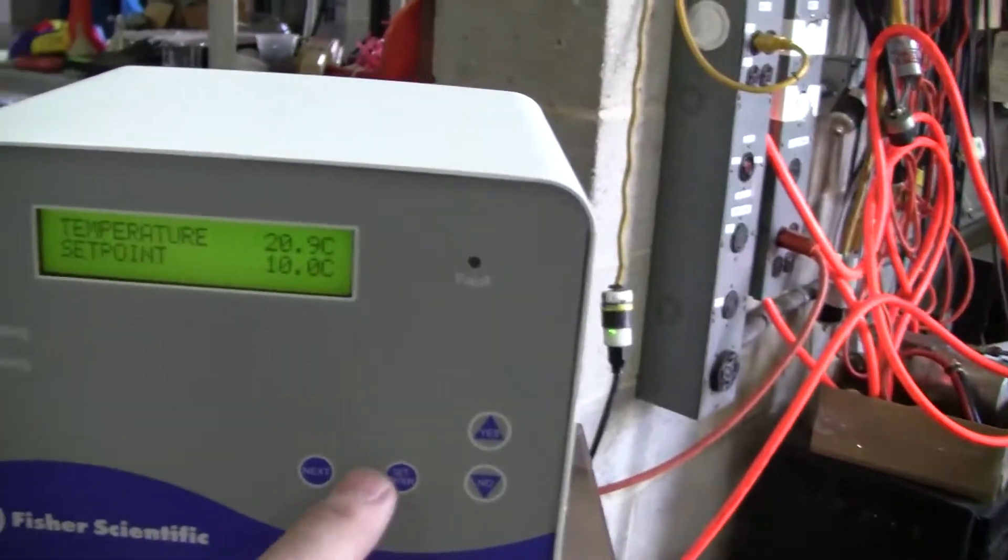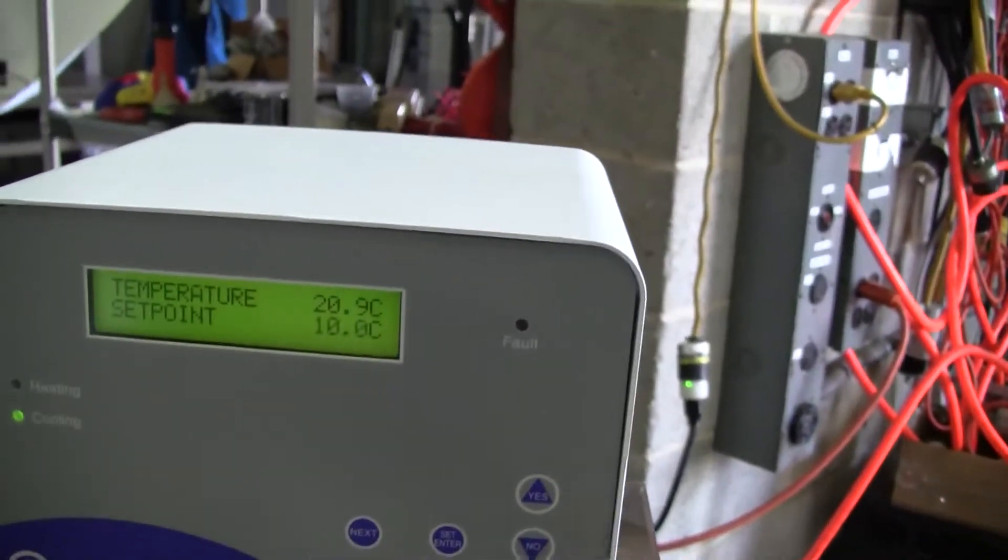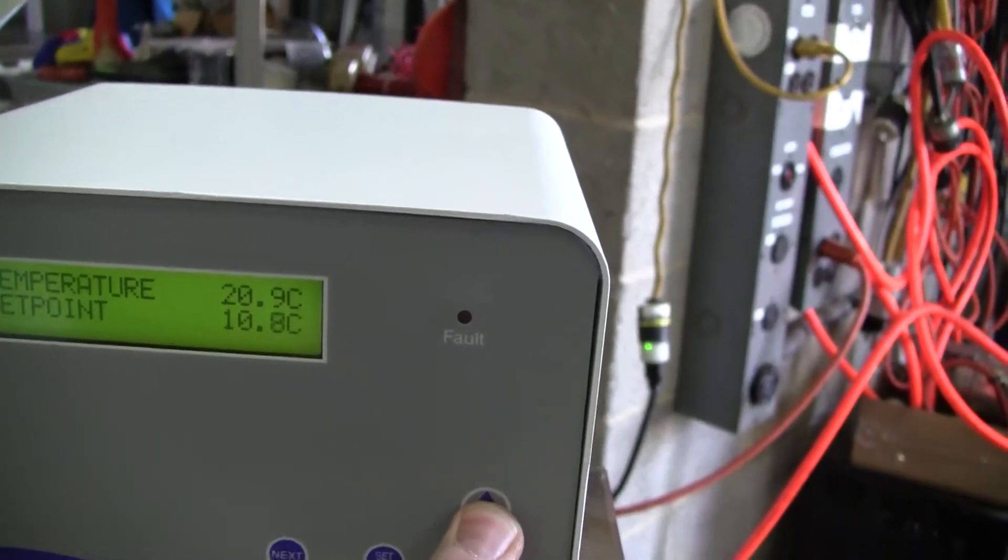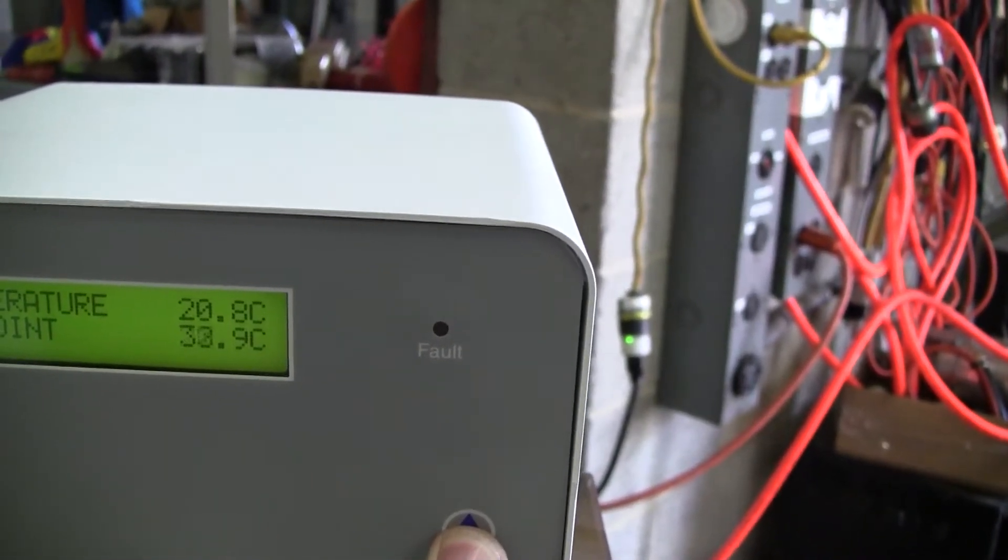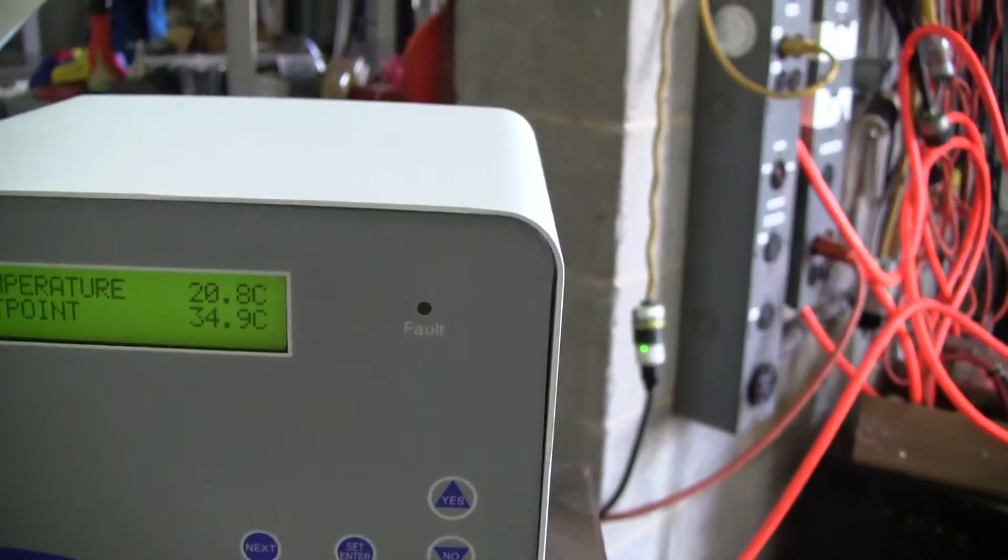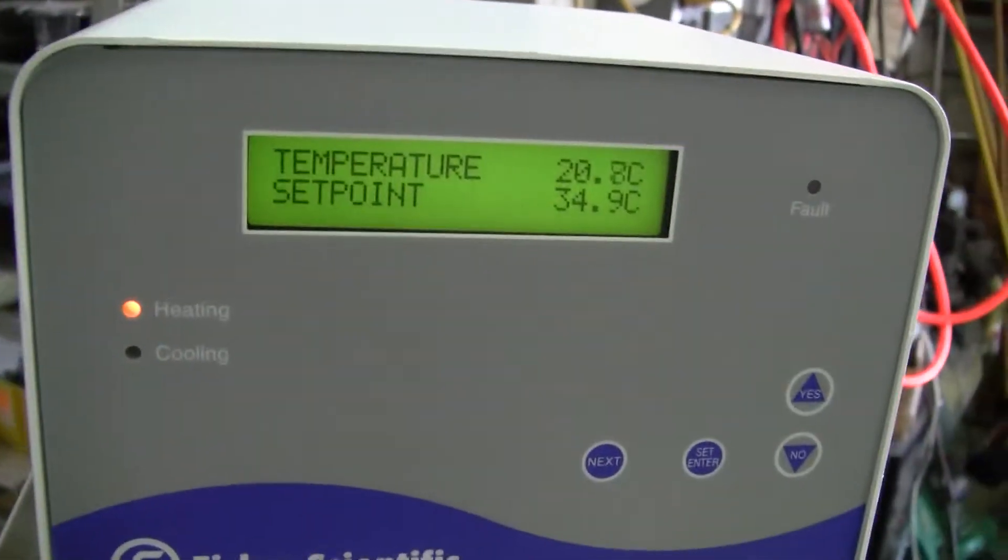We can set the heat. Let's raise the set point. Set point to 34. And you can see the heat came in.